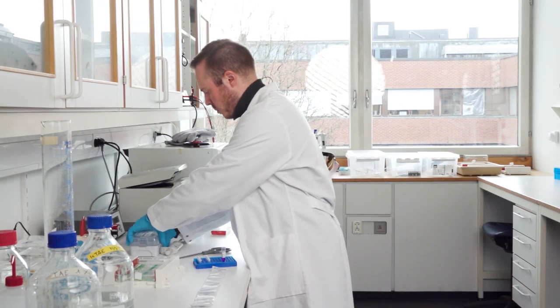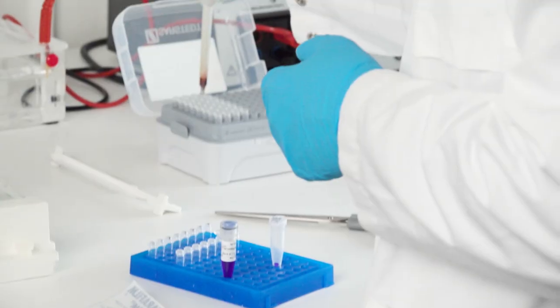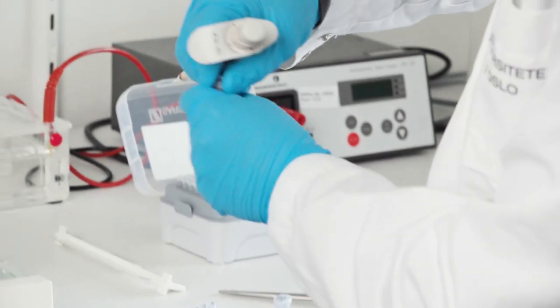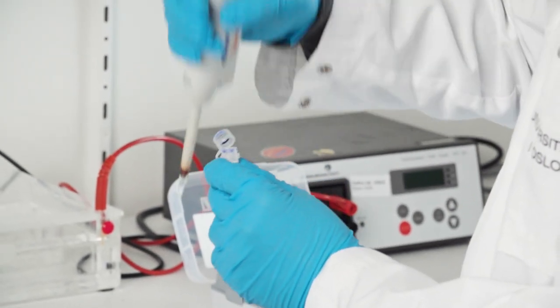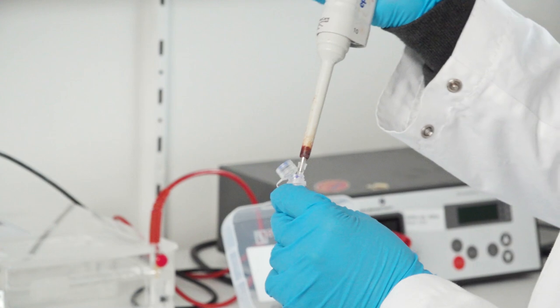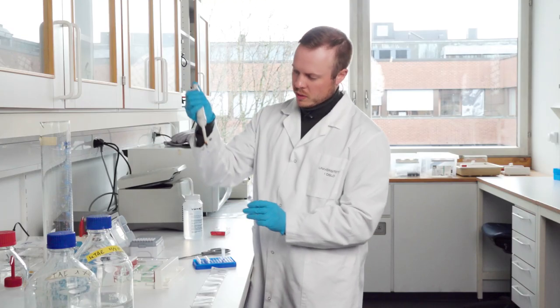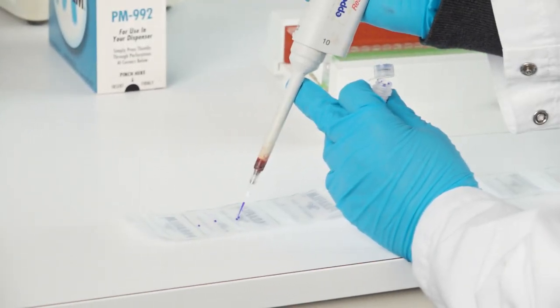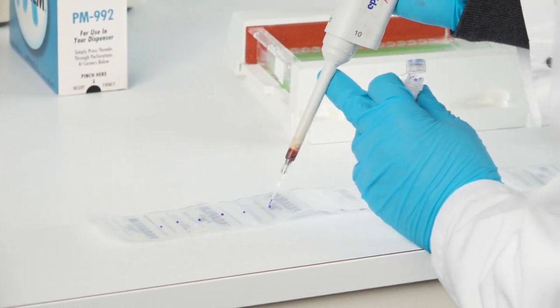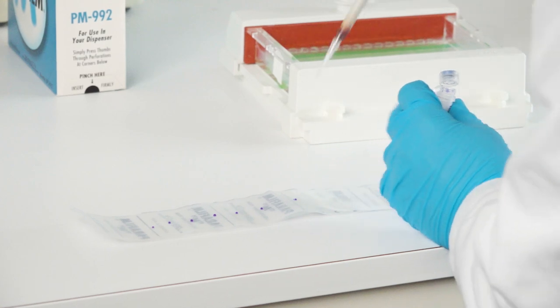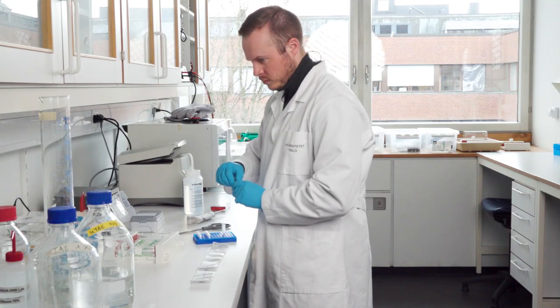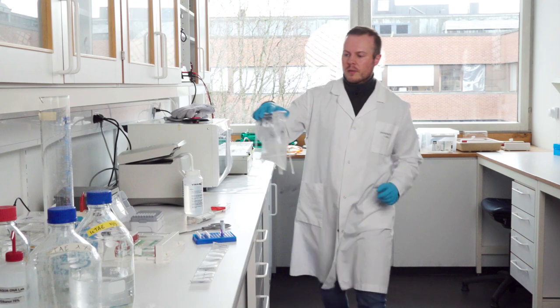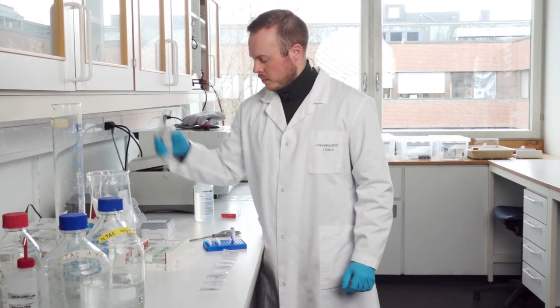So then I take a pipette tip and take it to the highest amount which is 10 microliter and I open the cap, suck up the solution, and I make small droplets in a row that is approximately one microliter. I close it and also get the trash for the pipette tips.